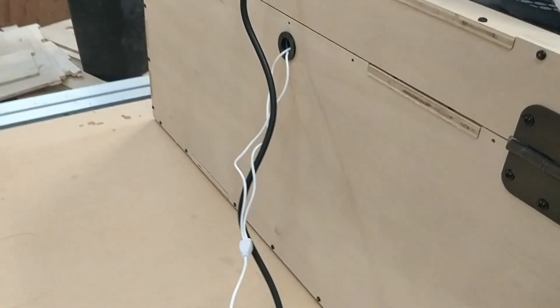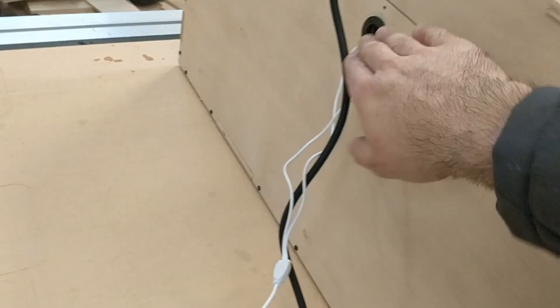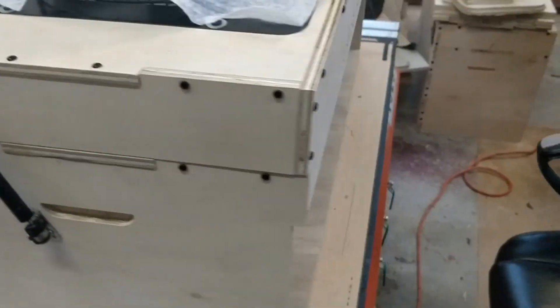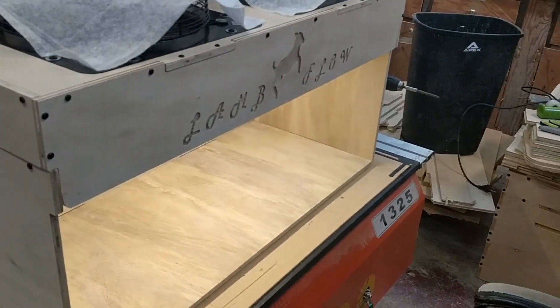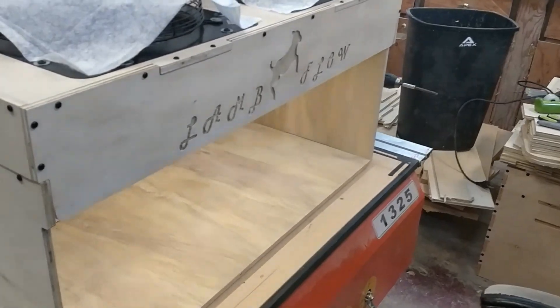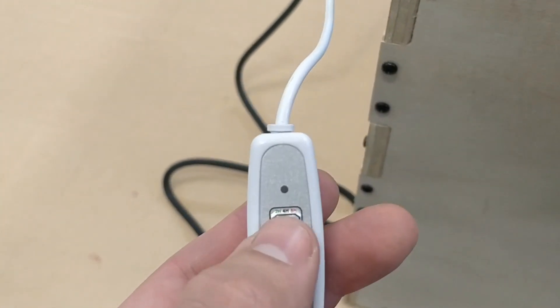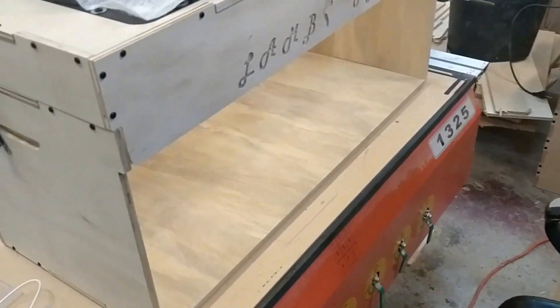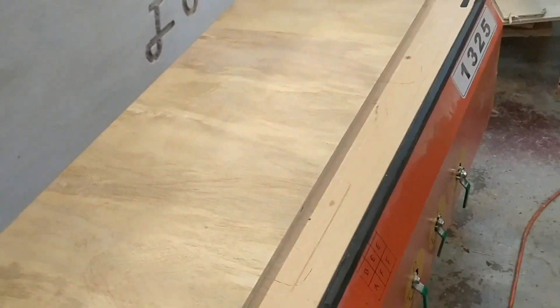Feed the cord through — I fed the USB through the cover so I could put the cover on, then plugged it in. It's got power so we can give it a test and that looks good. There are dimmable settings as well as a 2, 4, and 8 hour timer, so you can turn it on automatically for a set amount of time each day. I'll throw the lamination on the base and that should be it.